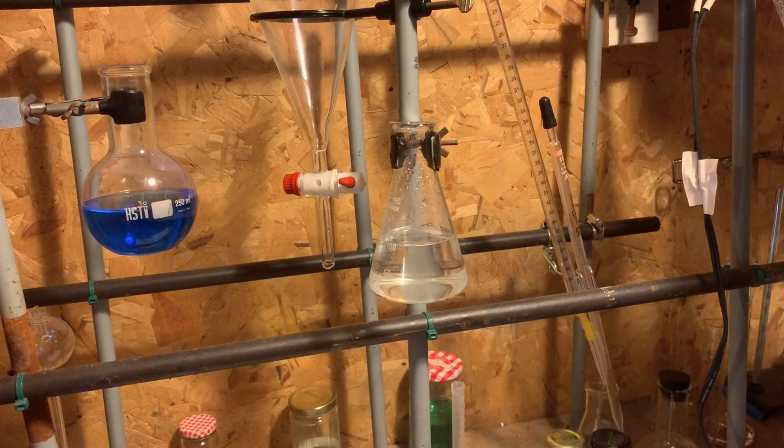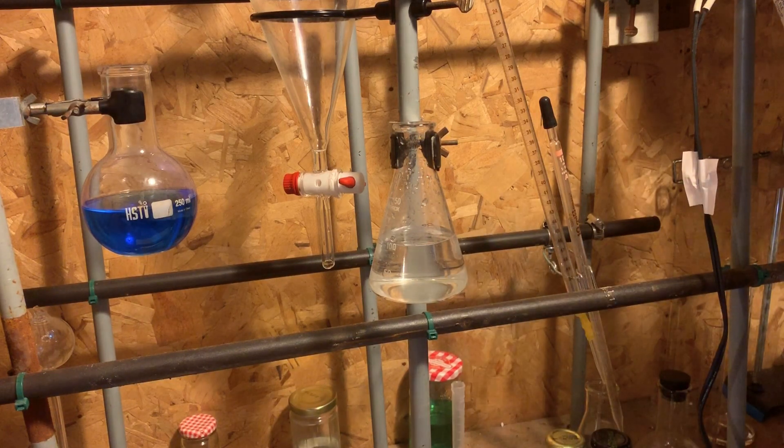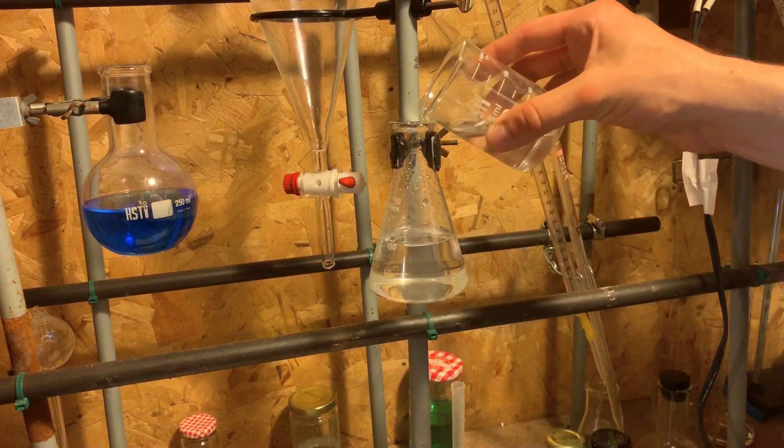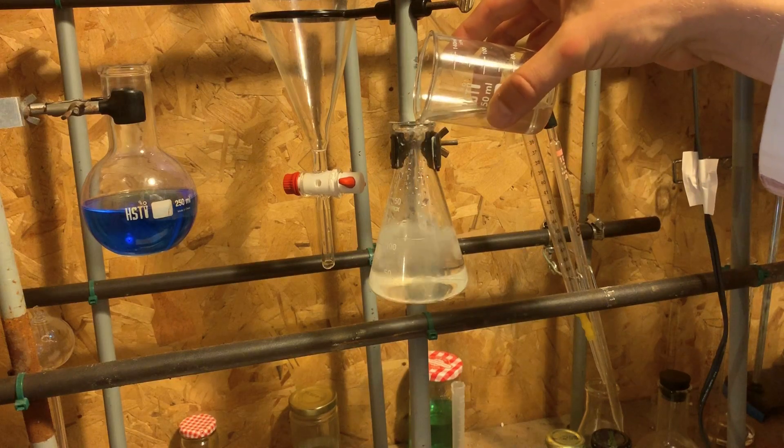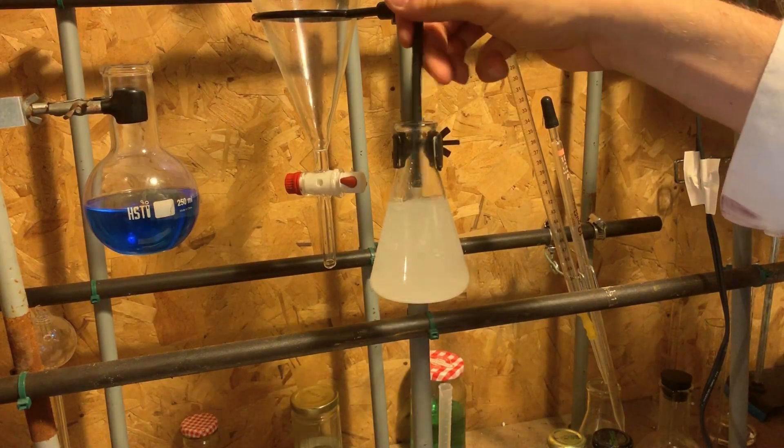I'm now going to add the acetone to the solution of sodium bromide. I'm going to mix the solution around.